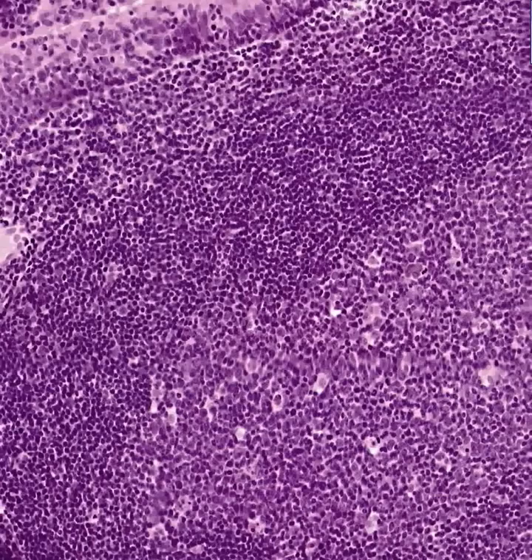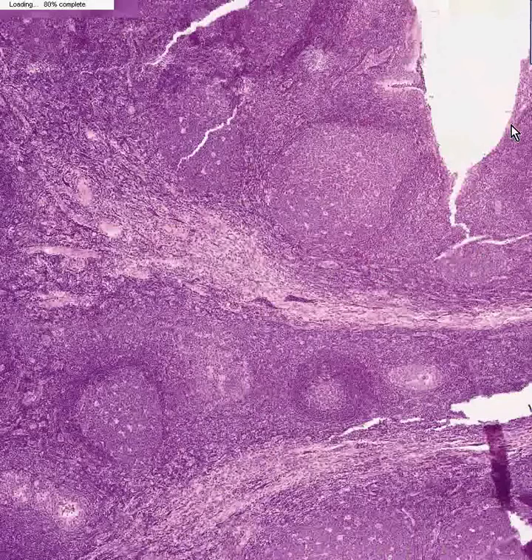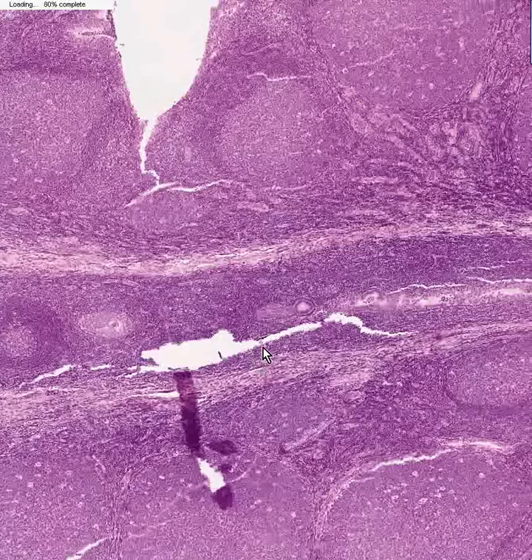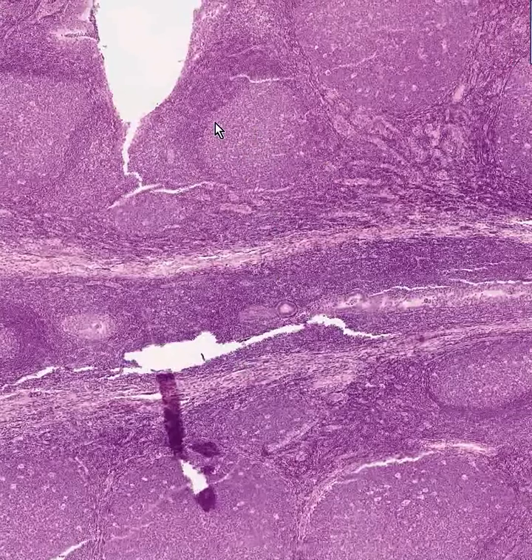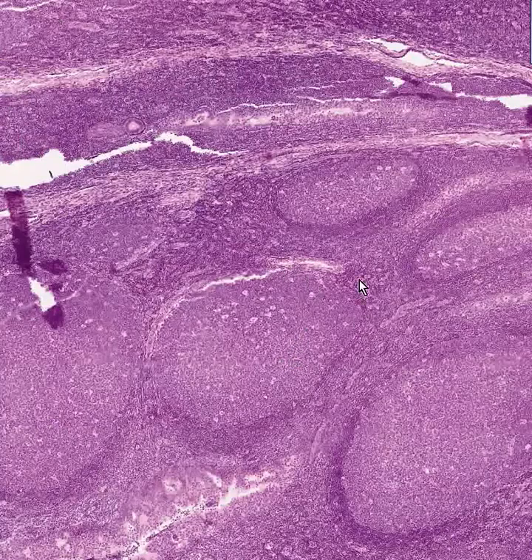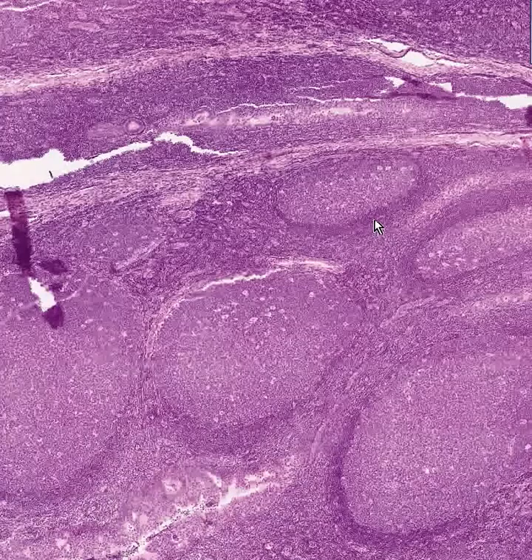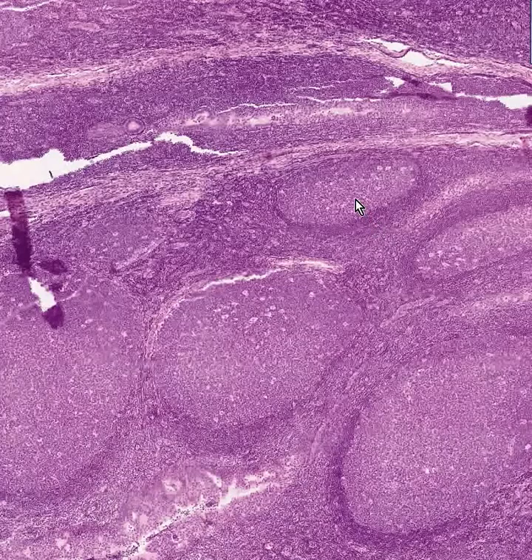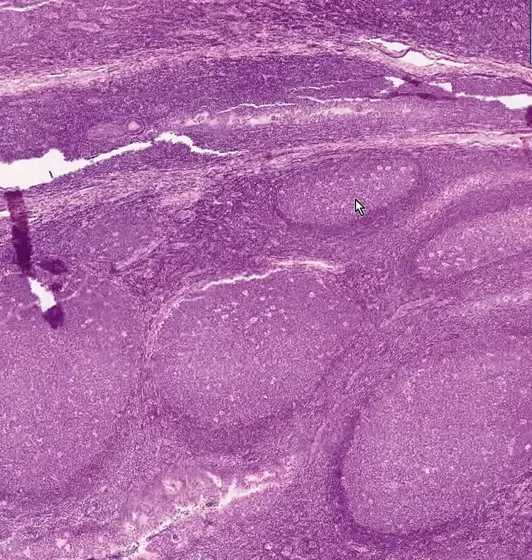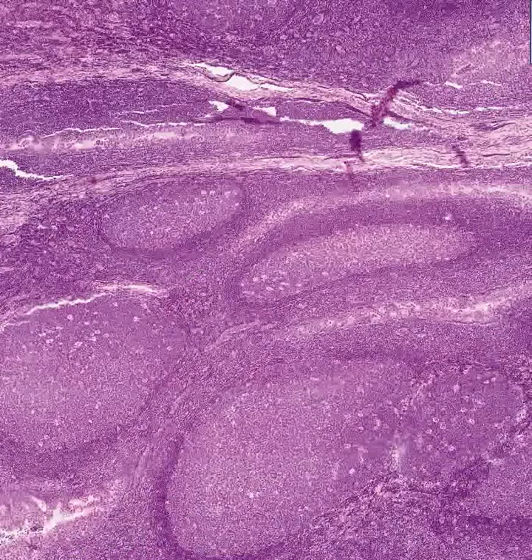This is a classical adenoid or pharyngeal tonsil. The follicles here are various sizes and shapes and are generally pretty big. They are generally all 100 percent lymphocytes, with less cytoplasm towards the periphery and more active, larger nuclei, more cytoplasm, and more differentiation on the inside of the follicle.